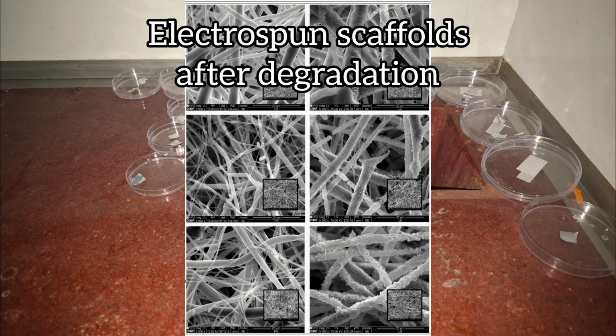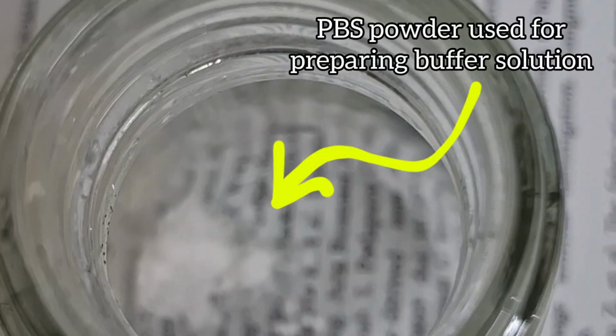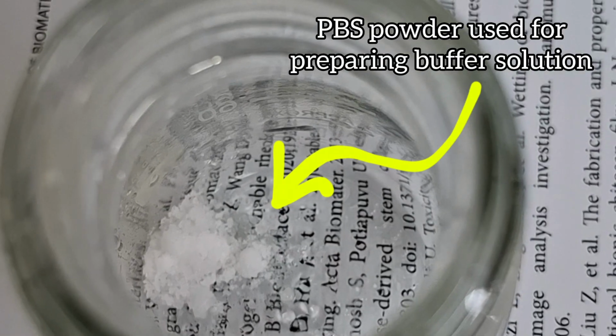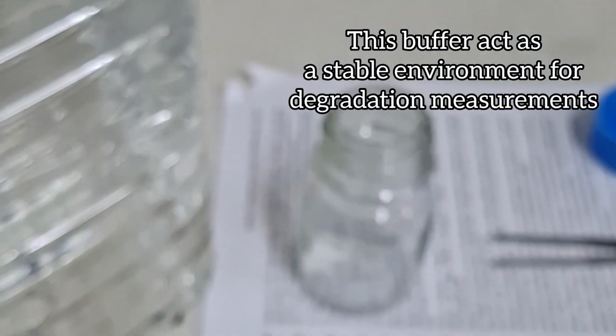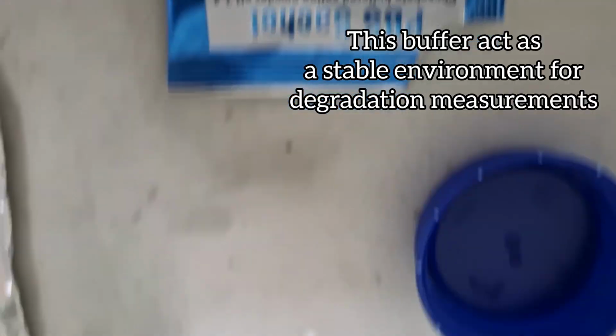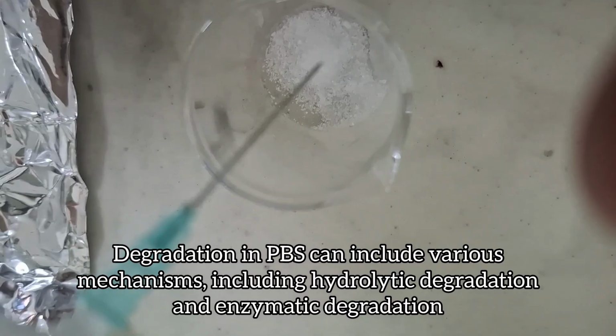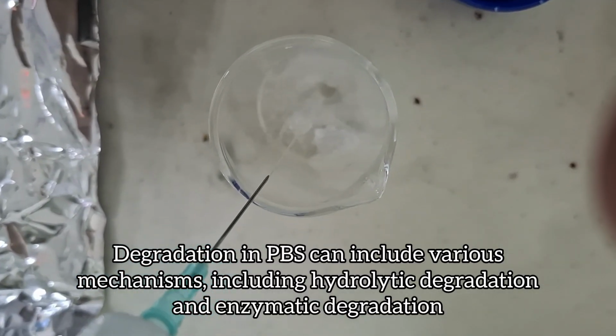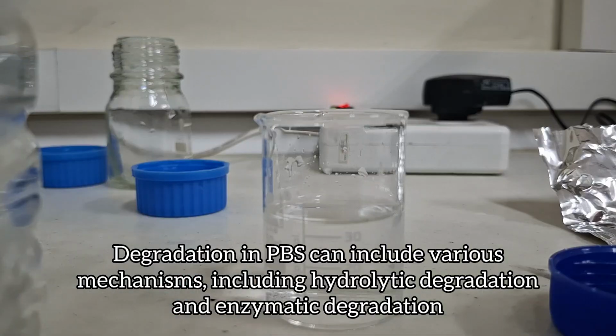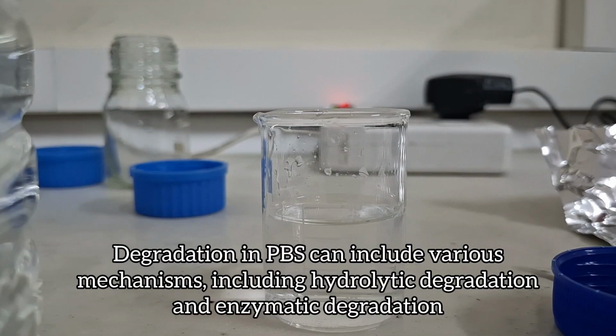Also make sure that the dimensions and weight of samples are equal and comparable, so that the only factors affecting degradation behavior are the variable components you mentioned. You can use ASTM standards as a reference. Usually PBS solution is used in this test. Prepare it by simply dissolving the appropriate amount of PBS powder or tablets in water. Make sure to record the concentration of the solution so that you can use the same concentration throughout the experiment.